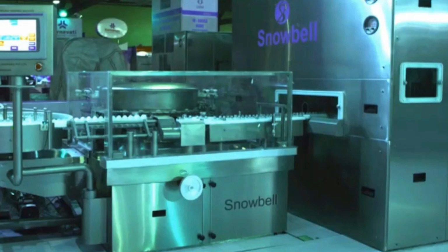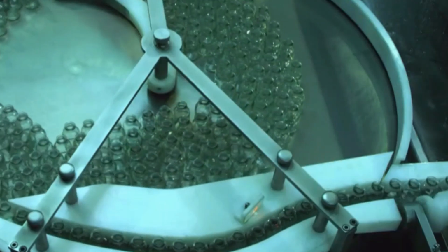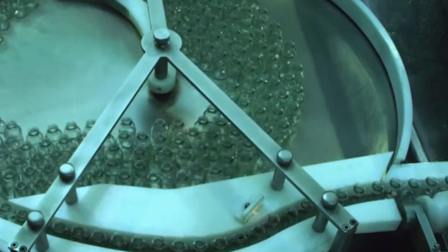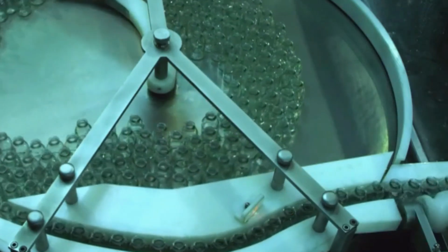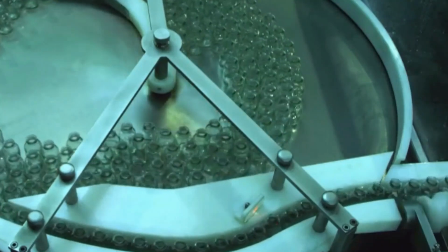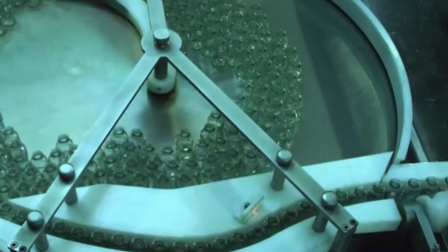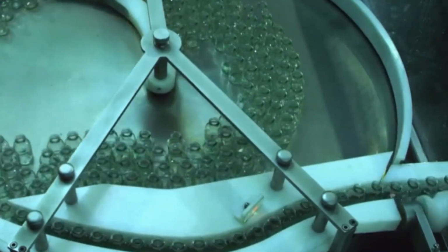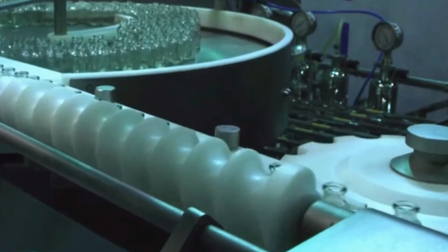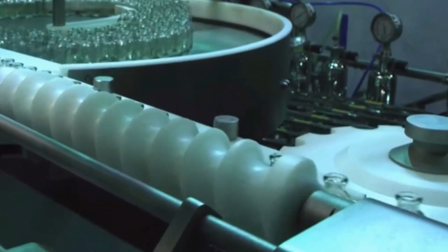The tunnel is part of an automated line that usually follows the washing stage, where the containers are cleaned and prepared for sterilization. Once in the tunnel, the containers move through different zones: a heating zone, for depyrogenation, a holding zone, to maintain the high temperature for the necessary time, and a cooling zone, to reduce the temperature before the containers exit the tunnel. Depyrogenation tunnels are essential in ensuring that containers used in sterile pharmaceutical products are free of harmful pyrogens, which could lead to adverse reactions in patients, such as fever or more severe complications.